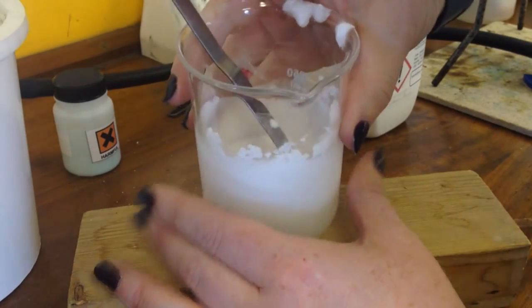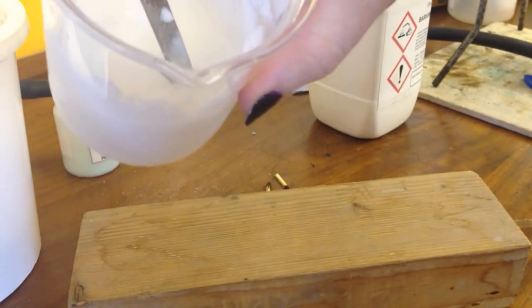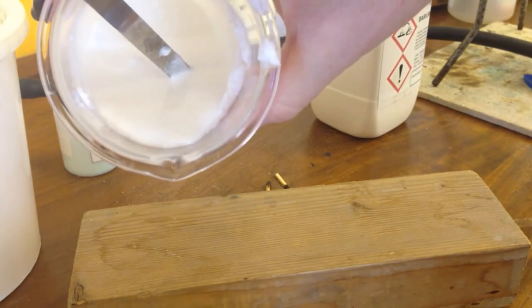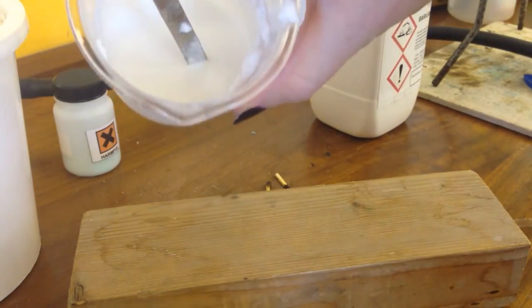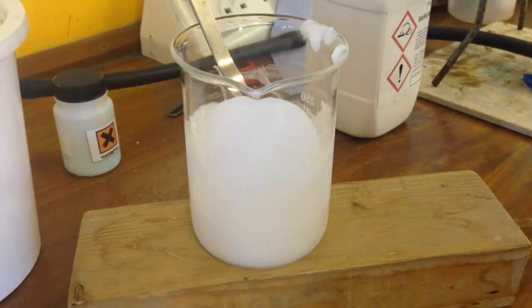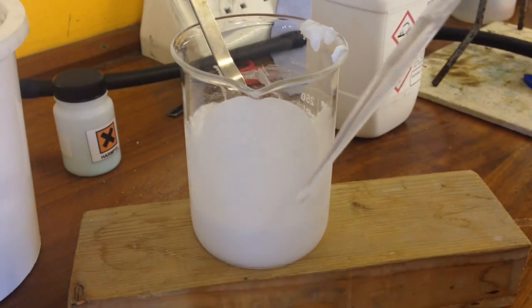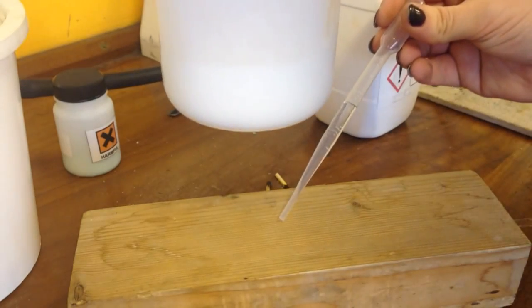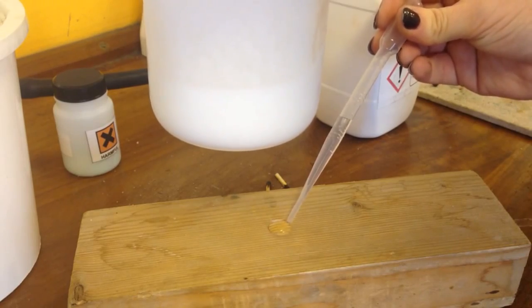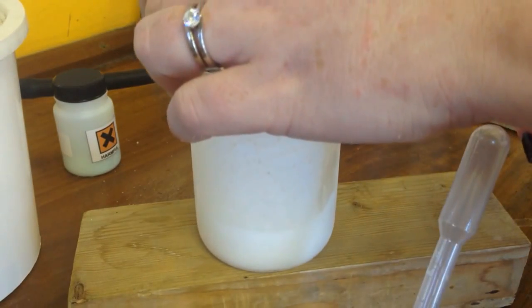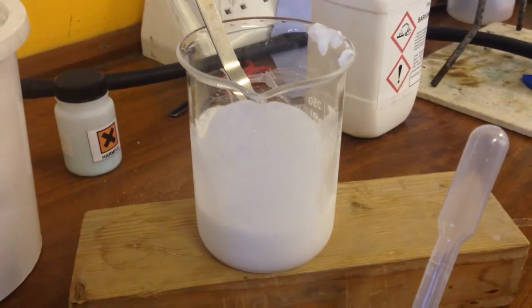Now the two of them are mixed. And if I show you that, you can actually see it's liquid. And just to prove to you that it is actually cold, I've got a wooden block here and I've got some water. So I'm just going to pop a drop of water under there.